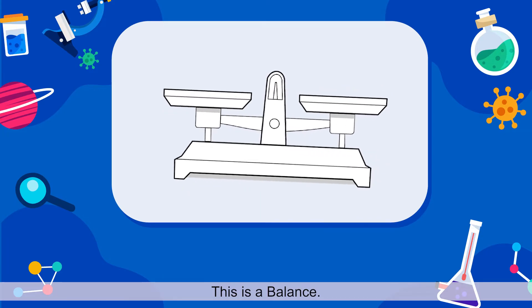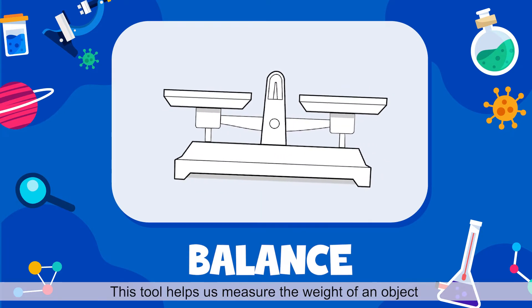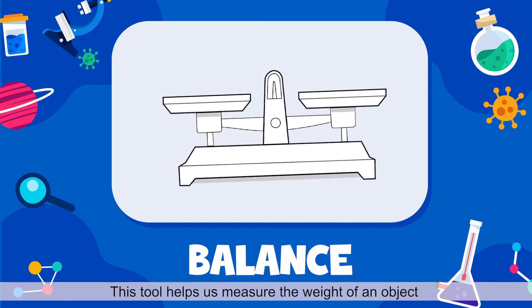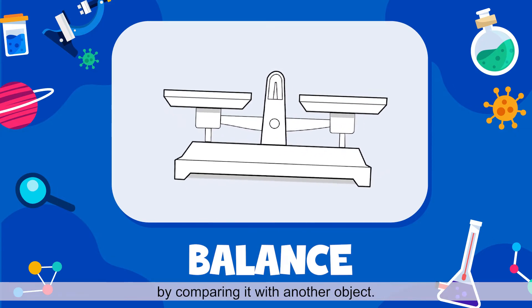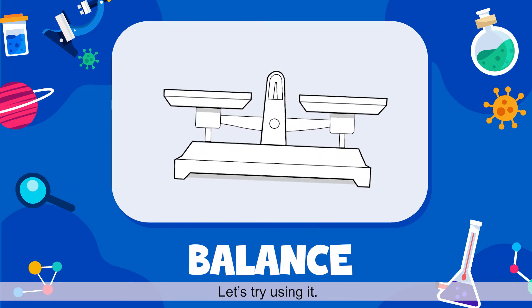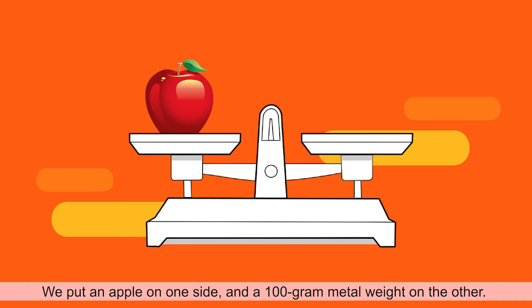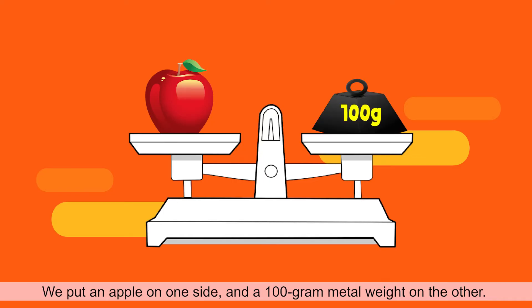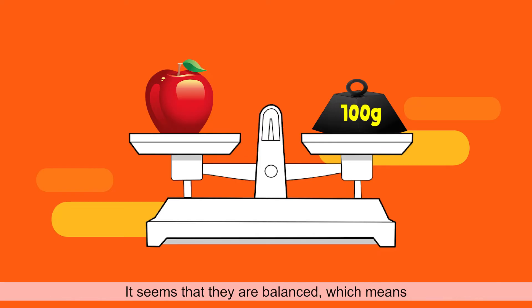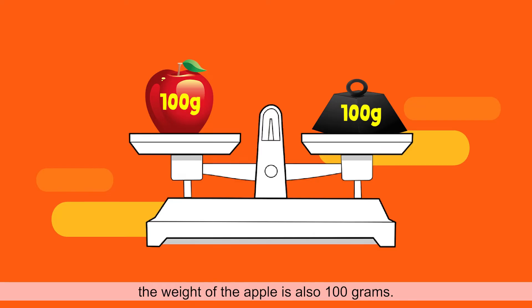This is a balance. This tool helps us measure the weight of an object by comparing it with another object. Let's try using it. We put an apple on one side, and a 100 gram metal weight on the other. It seems that they are balanced, which means the weight of the apple is also 100 grams.